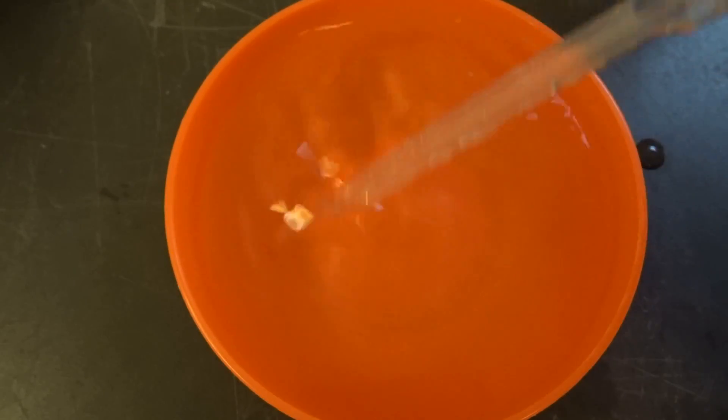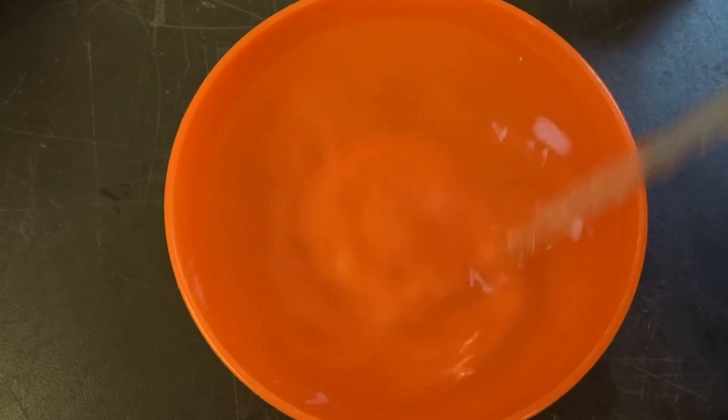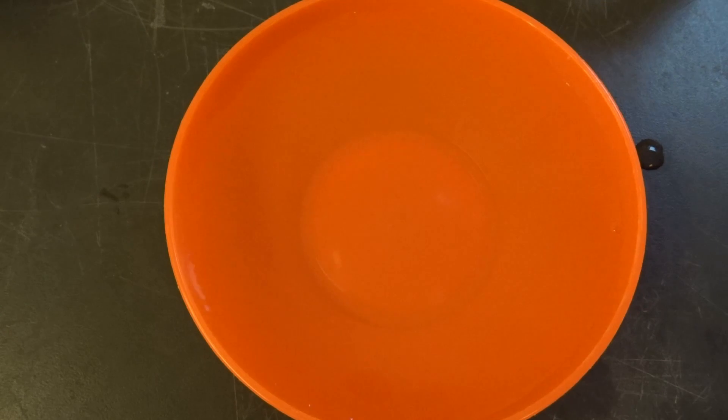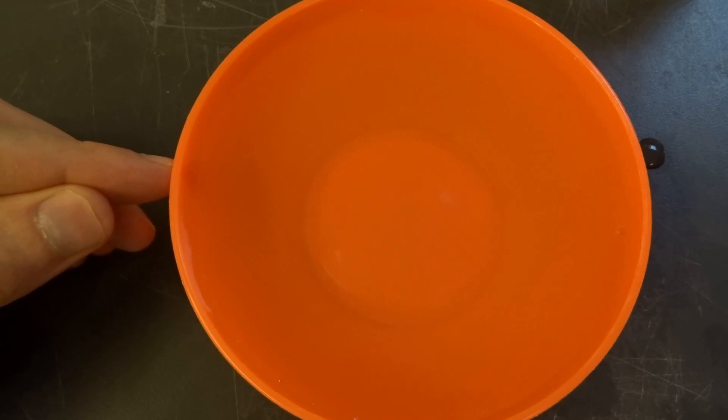And the first one I filled up to the top, so the less silicate or the more water you use, the softer and thinner will be your gel, but they are really fragile. So I made them a bit stronger than they usually are, and maybe this helps to dry them easier subcritically, so without needing to build the supercritical dryer.